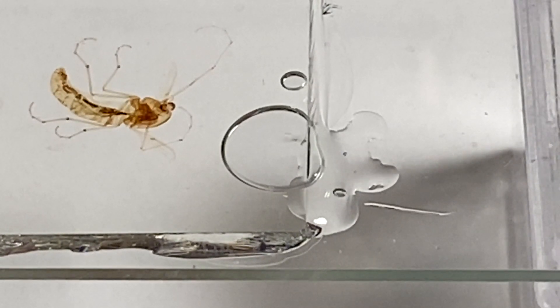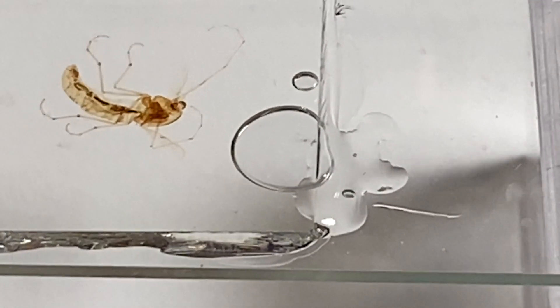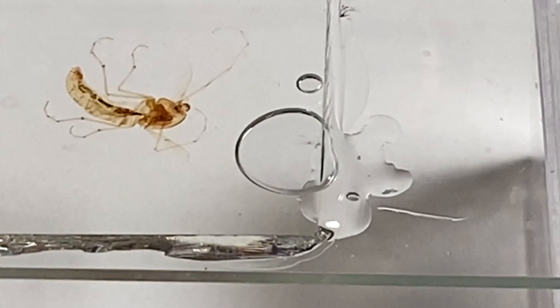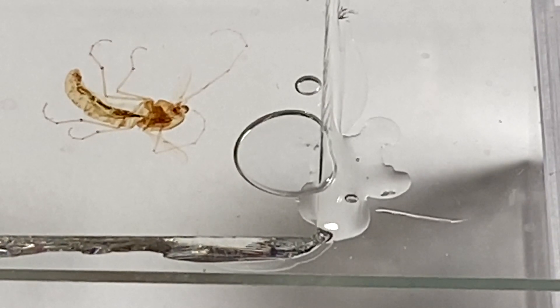This is a short video on how I developed a method to remove bubbles from my slide preparation. I suppose we've all been through it — we have prepared our fantastic whole-mount insect. In this case I have over here what looks like a flying insect called a blind mosquito. I don't know why it's called a blind mosquito in Florida.